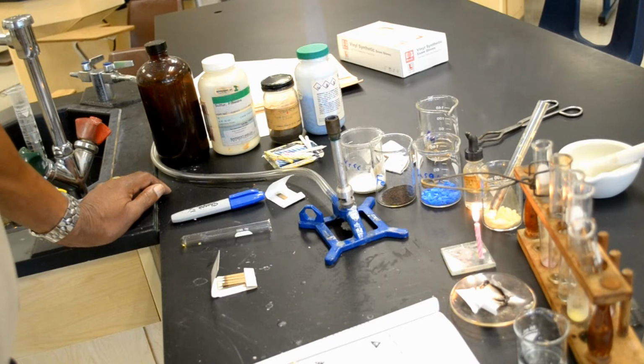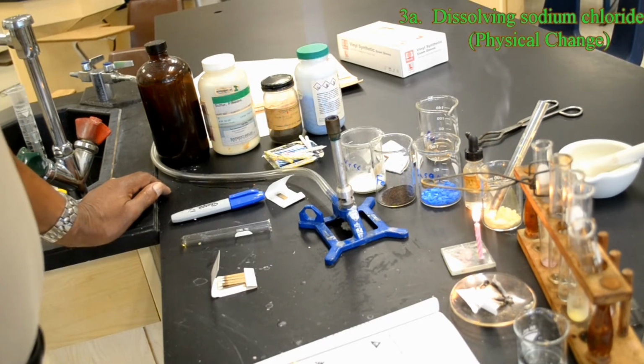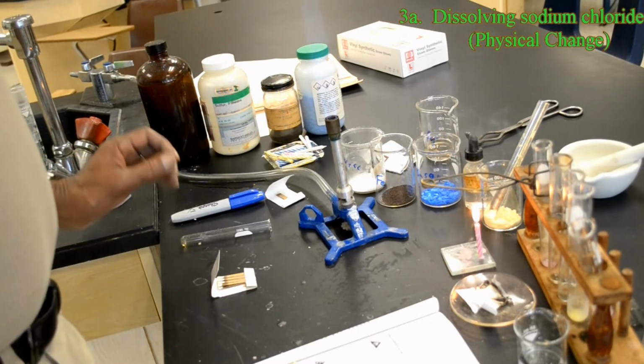Number 3, add a microspatula of NaCl, sodium chloride, to a small quantity of water.